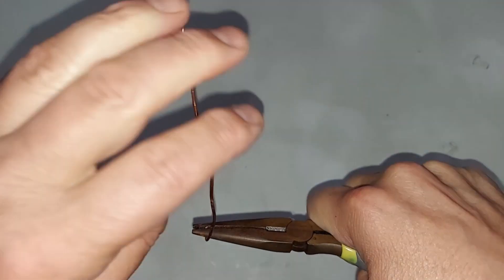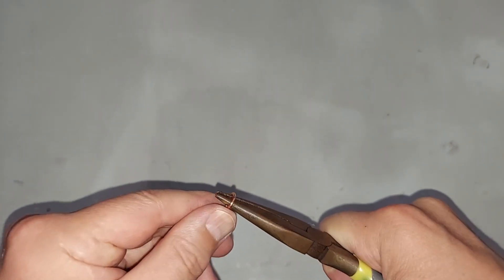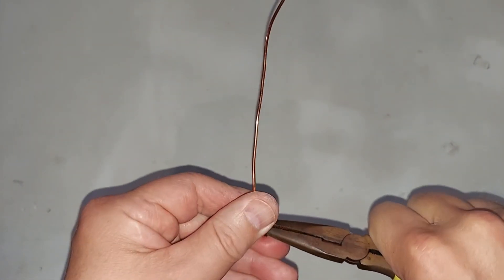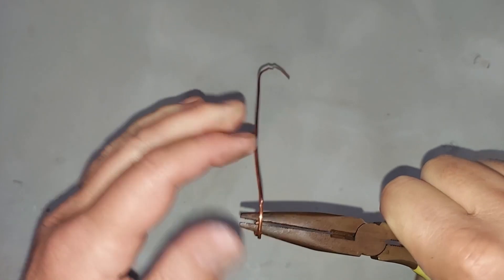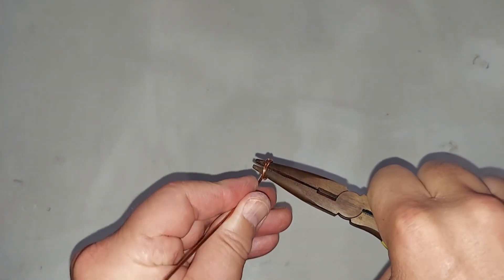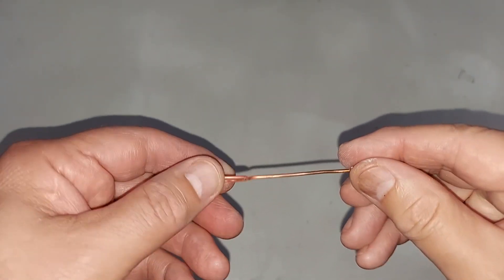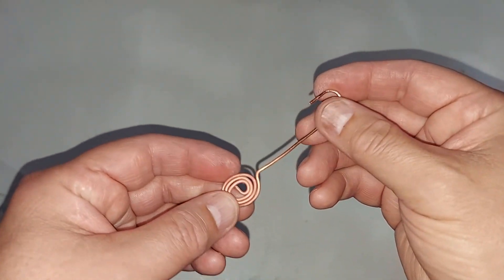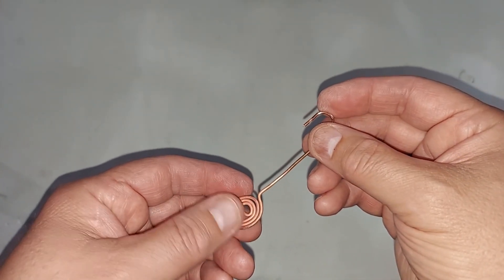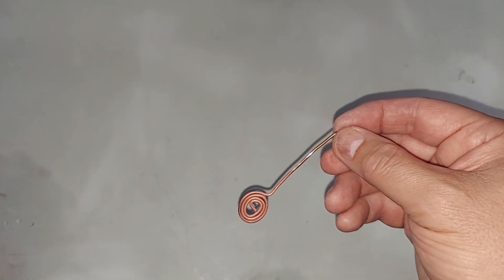The idea is to make a coil of wire. I got this copper wire off of an electronic coil and it was wrapped tightly so it's a bit bent in funny ways - I straightened it the best I could but it's perfect for this experiment. I'm done with the coil now. It looks a little funky because I heated it just to make sure it wouldn't break. Once it gets red hot you're done, then you can start using it in the experiment.